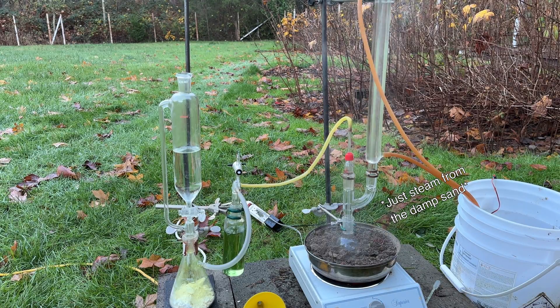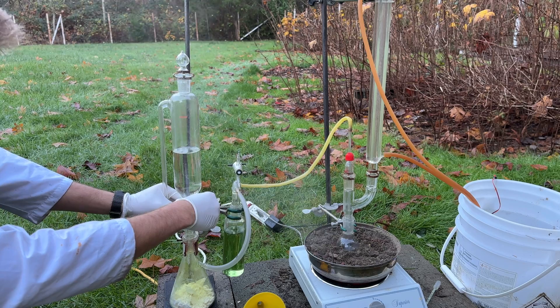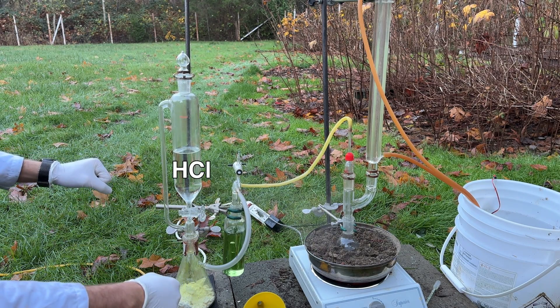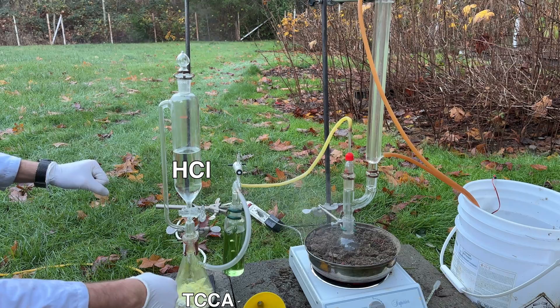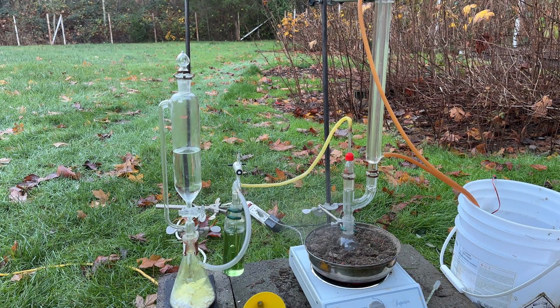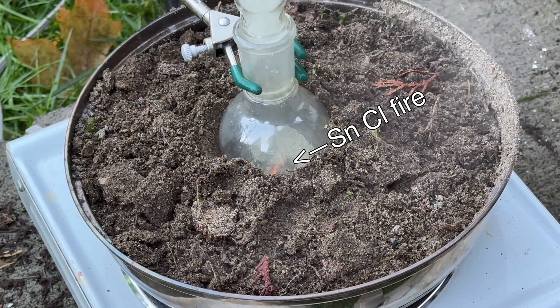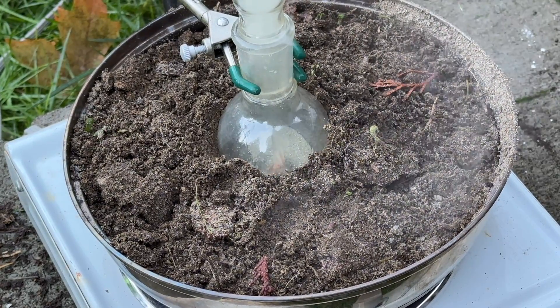To begin the reaction, the hot plate was turned on to preheat the tin. Once warmed, the chlorine gas generator was started by slowly dripping hydrochloric acid into some trichloroisocyanuric acid. The chlorine gas produced was dried by bubbling it through some concentrated sulfuric acid, and then immediately a tin-chlorine fire started in the 100 milliliter flask and tin tetrachloride began to be produced.